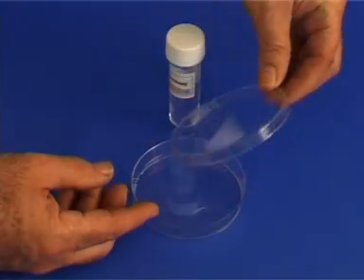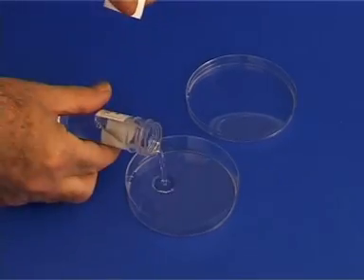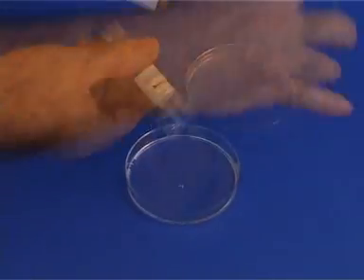Remove the cover from the petri dish, pour the transparent solution into it and replace the cover.